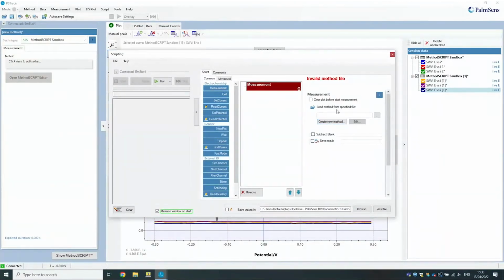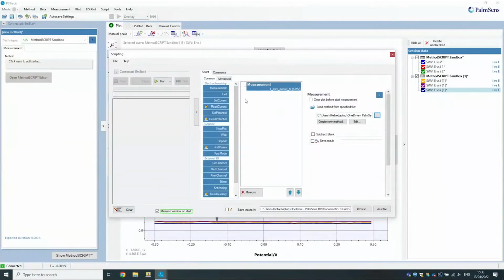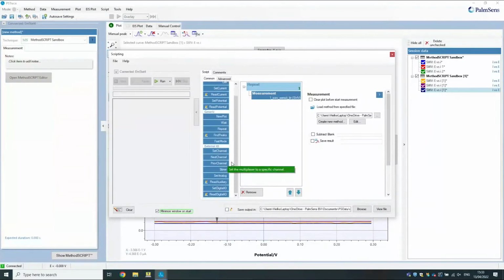What you do is you have these measurement blocks that you can fill with methods, and you can basically choose any one, and then you can put another measurement block, and you can put a repeat loop, and you can put commands to set a potential, read out the analog input, set the IOs, the digital inputs and outputs. These kinds of things you can do with that scripting. So it's already a bit more powerful than just the simple interface of PSTrace, because it gives you control, for example, over the digital inputs and outputs, over the analog output. You can read out the analog input, and you can chain multiple measurements in this one. So that already gives you a lot of opportunities.